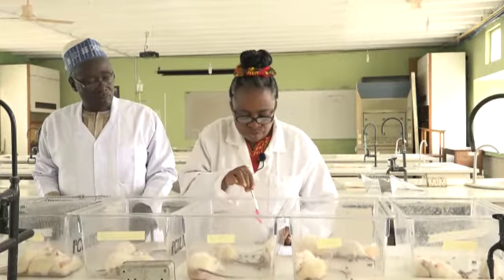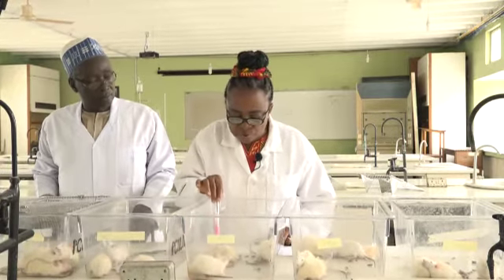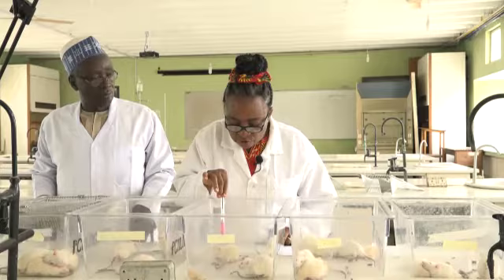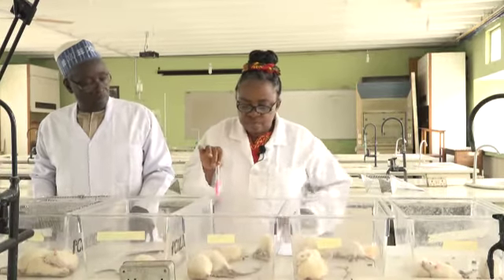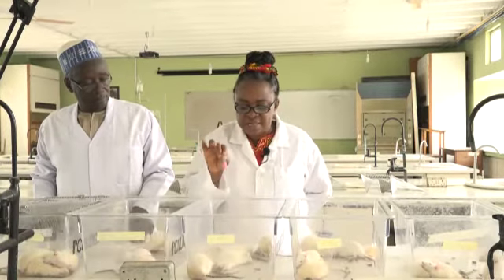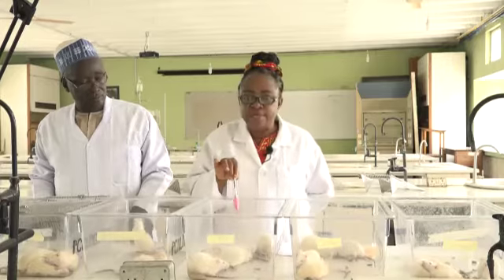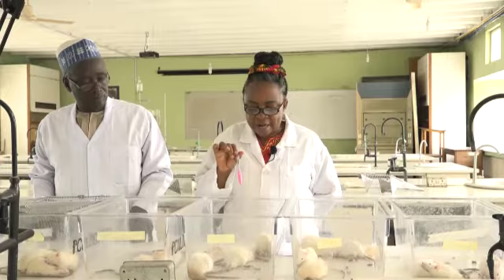You can see these two exhibiting tremors. You can see that the skeletal muscles are getting paralyzed. See how the hind limbs are being stretched out and sluggish. It can no longer move or stand on its feet. Watch this one. You can see the paralysis of the skeletal muscle has resulted in the inability of the rat to move in the normal way. You can see tremors, you can see convulsions, you can see difficulty in breathing. Eventually, these two rats are likely to die.